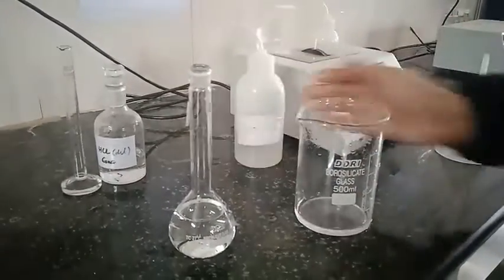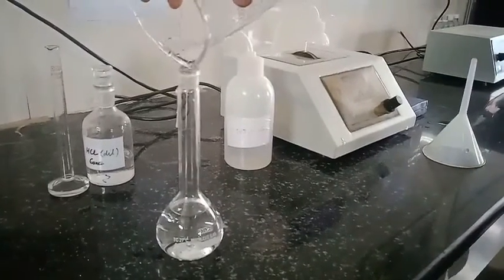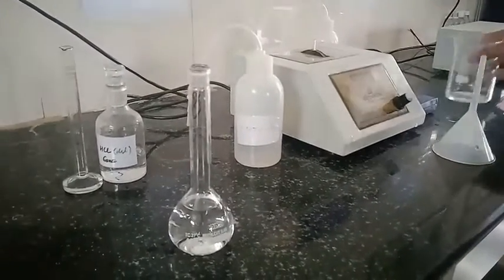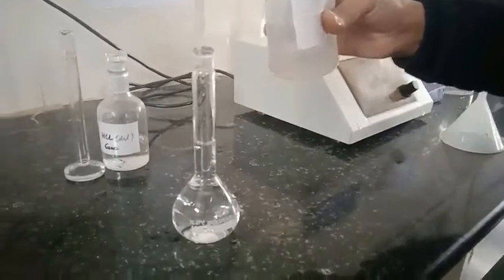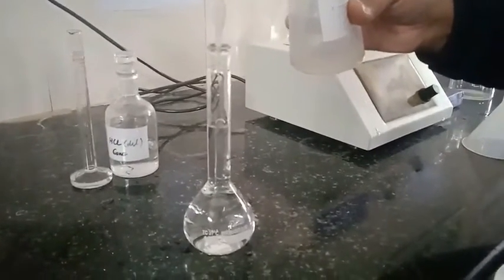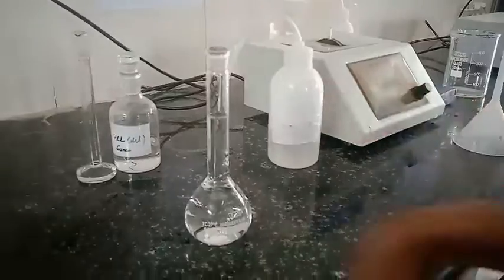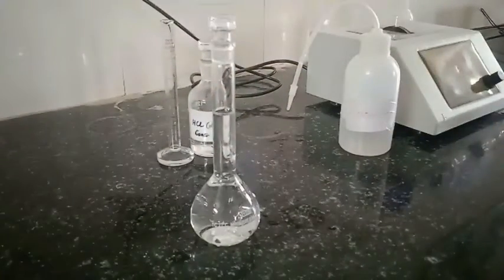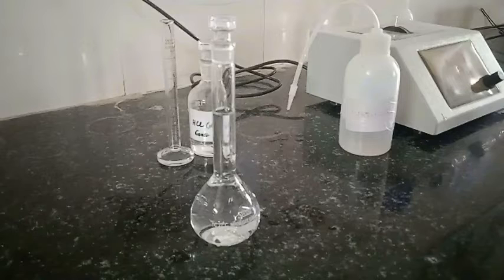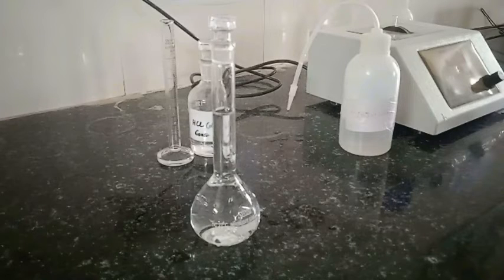In this manner we prepare the M/100 calcium carbonate solution, which is used for the standardization of EDTA solution. Shake it well. This solution is used for further titration. I hope you find this video helpful — thank you all for watching.